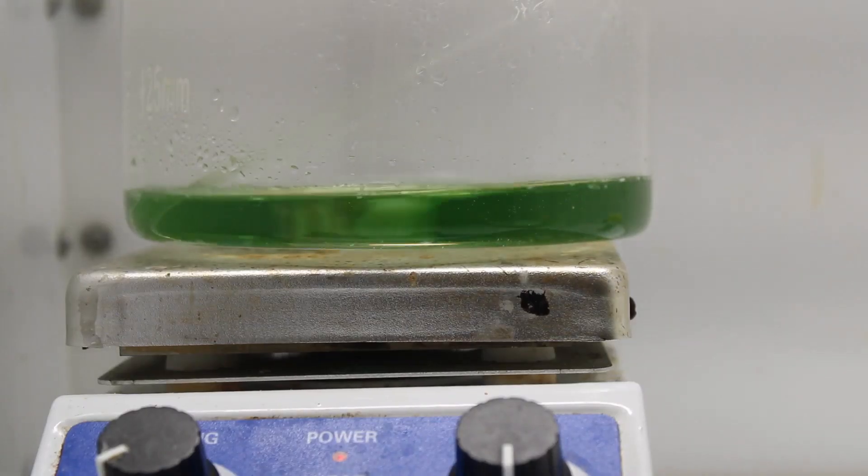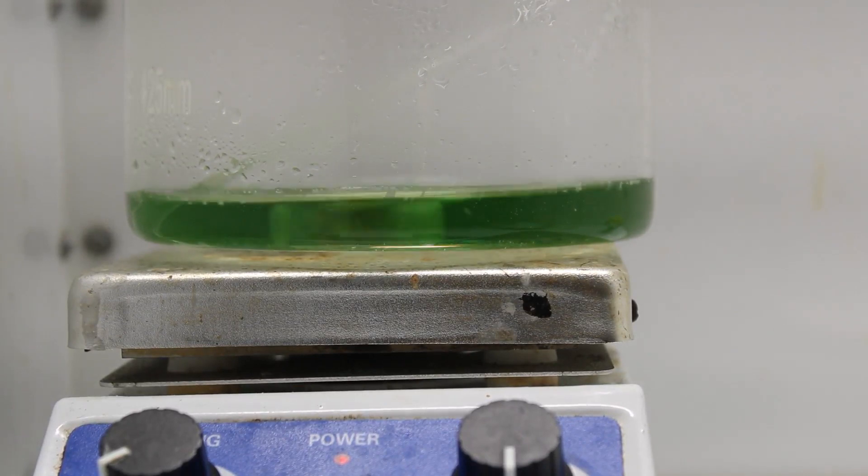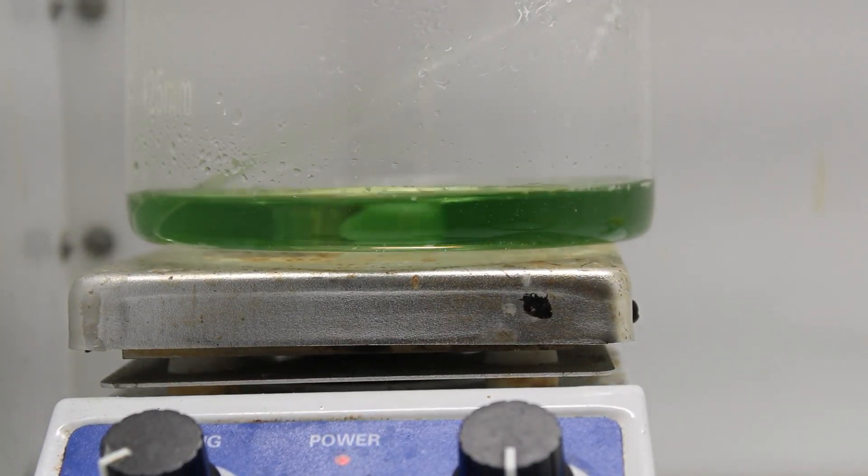The mother liquors are then evaporated, giving a second crop of crystals. The combined crystals are allowed to dry overnight in the fume hood.